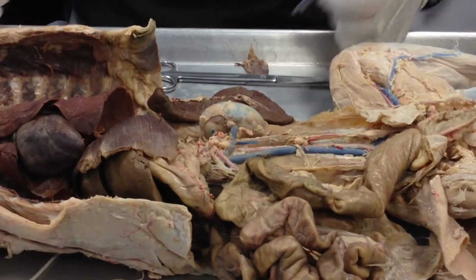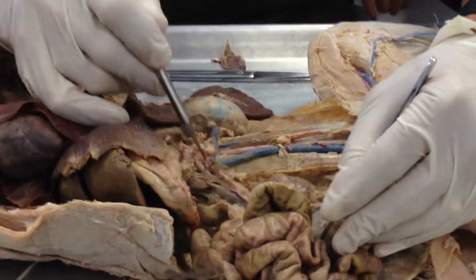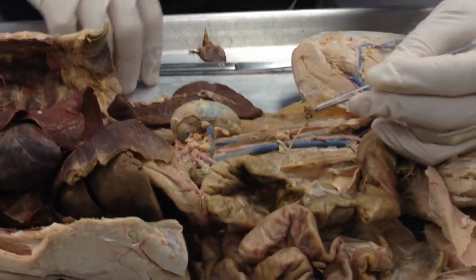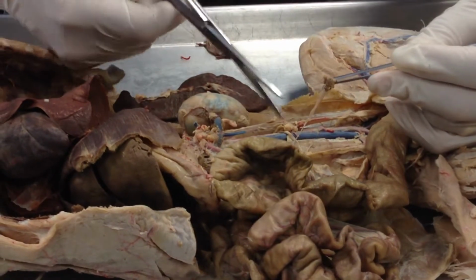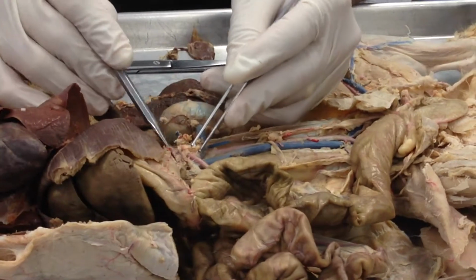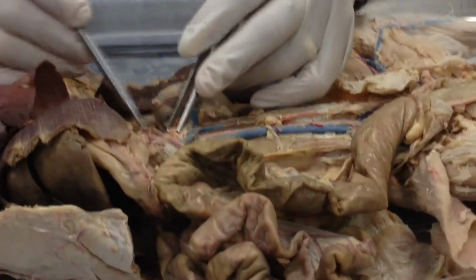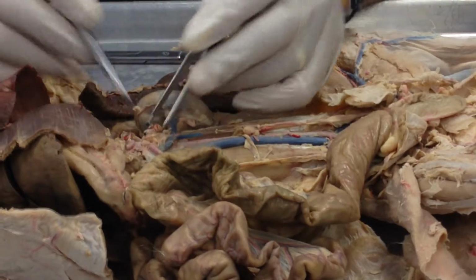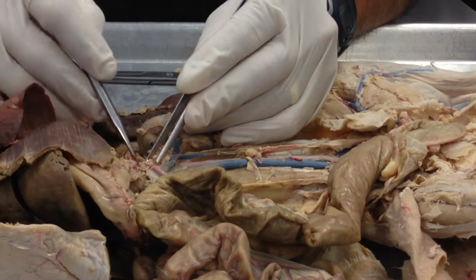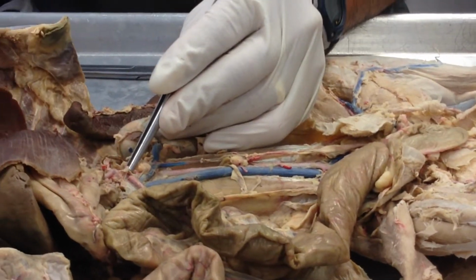The second one is the superior mesenteric artery. And as I said, for our interest during the lab, we saw all of these cream threads right there, and those are all nerves of the sympathetic nervous system. And there's my superior mesenteric, and right there, ladies and gentlemen, is that sesame seed-like structure, and that is the celiac plexus.